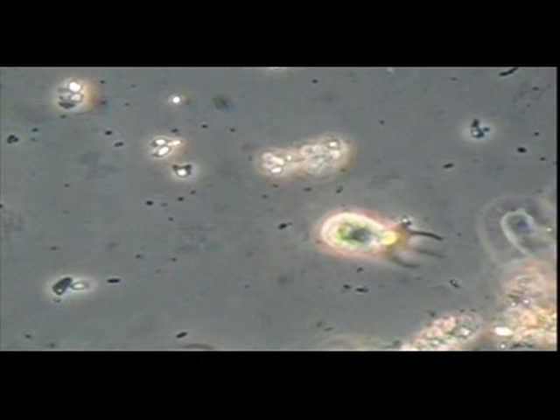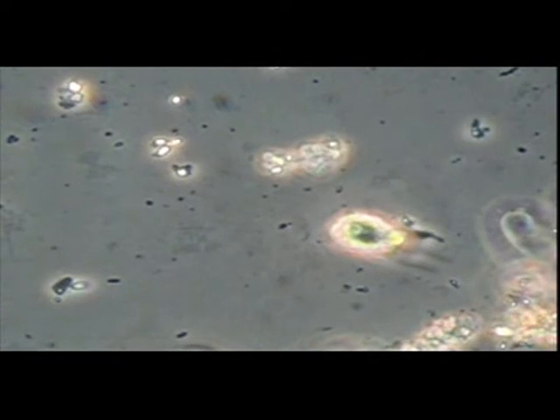Now we are amongst the soil amoebae. This specimen has been floating in the soil solution and has assumed a form that is difficult to identify. It is green because it has been eating algae. It is small and slow moving, and thus conforms to the popular view of soil amoebae.